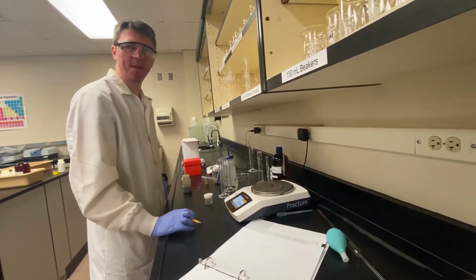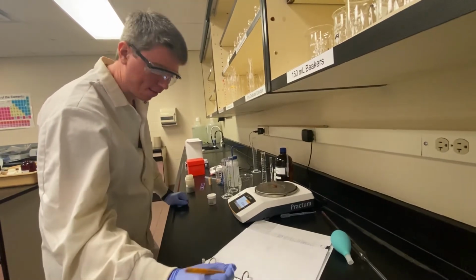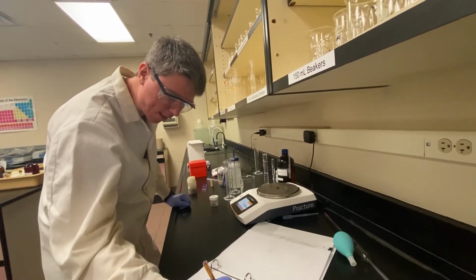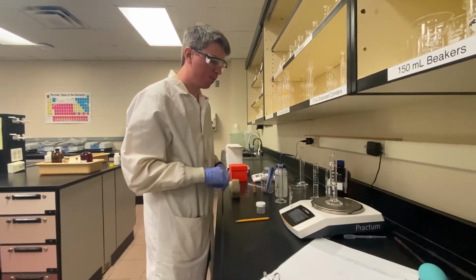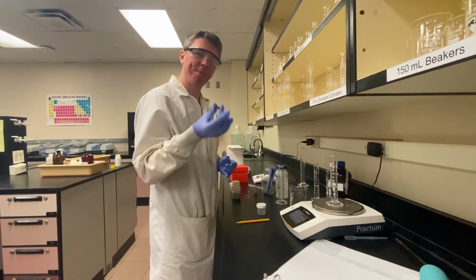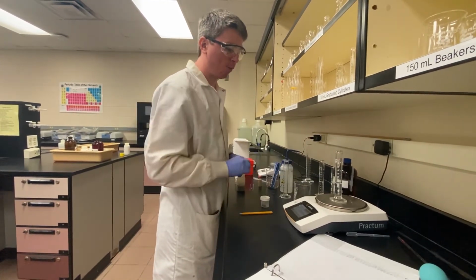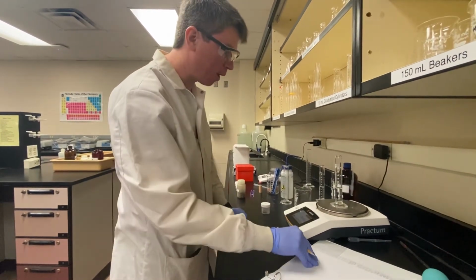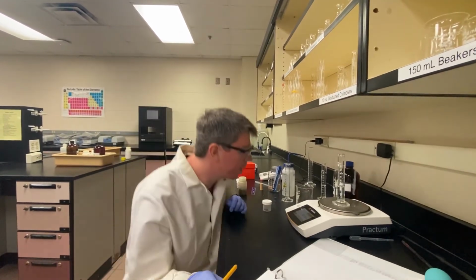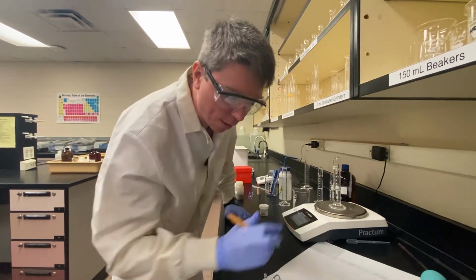Okay. So once we put the pennies on the scale, we'll get the mass of the 5 dry pennies as 15.40 grams. To get the volume of pennies, what we're going to do is do something called the displacement method. So we have some water added to a graduated cylinder. Its initial volume, I'm going to go ahead and take as 20.8.